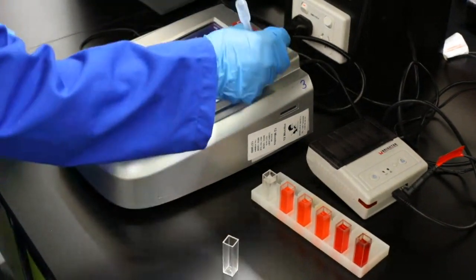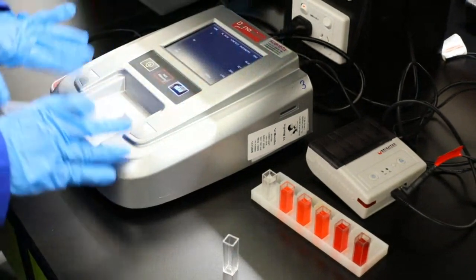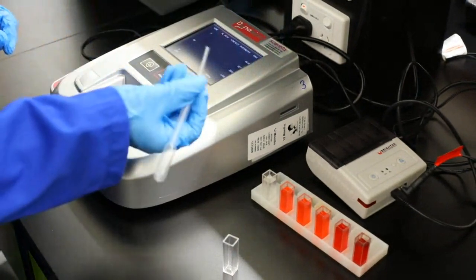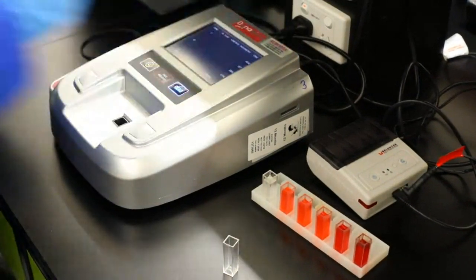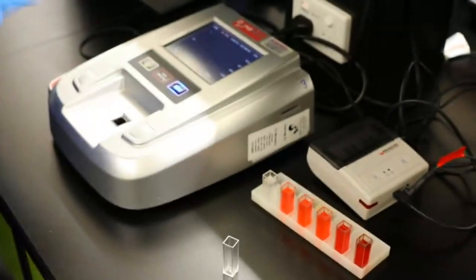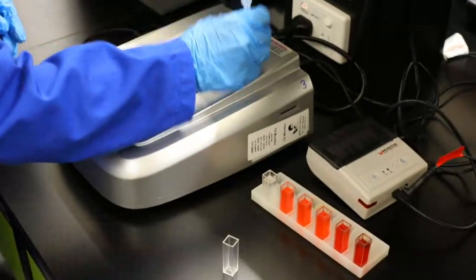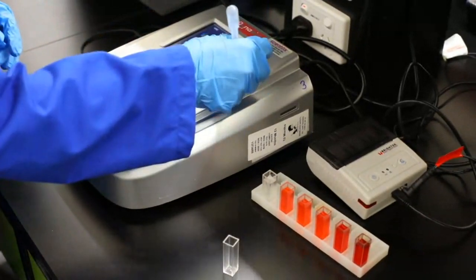So I'm going to use the Spectro. There are lots of different ones you can do. You can use this particular machine for DNA as well, which is pretty crazy. But before you get to do anything fun, you can set this up to do a beautiful calibration curve. In this case, I'm just going to do a photometric one, which just does our concentration. So I need to set this up.